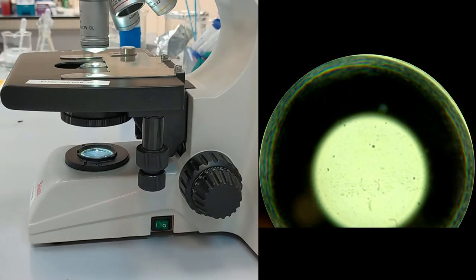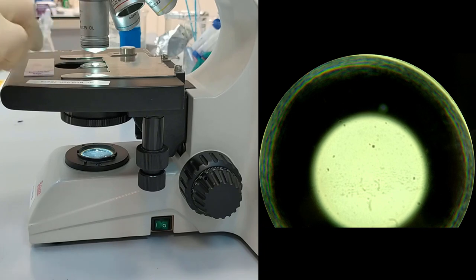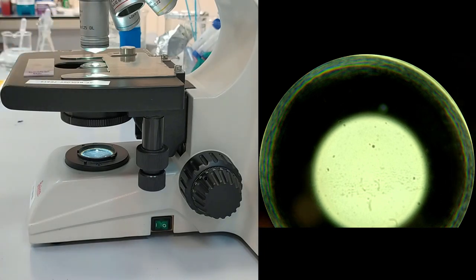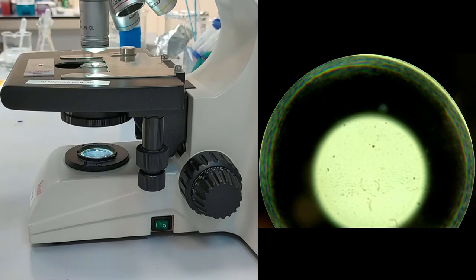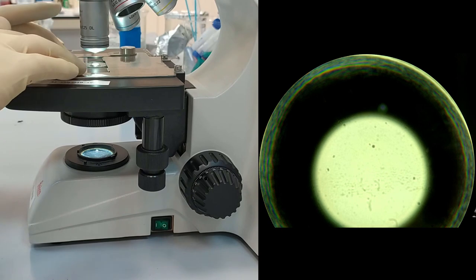Finally, we have the bacterial mix and we are going to use immersion oil also. Then we switch to the next part of the lab, which is finding the tissues of the human body.